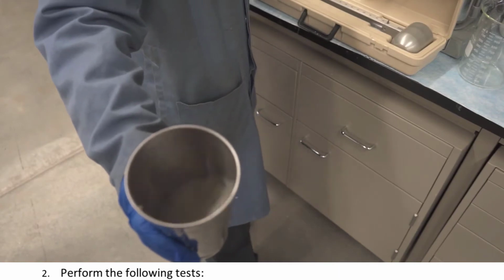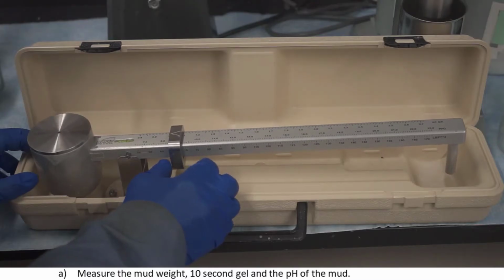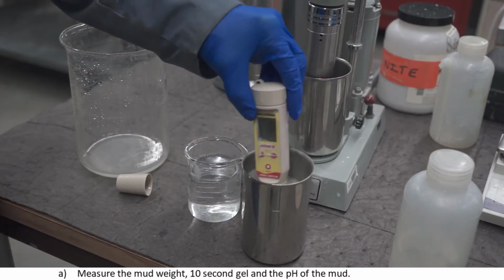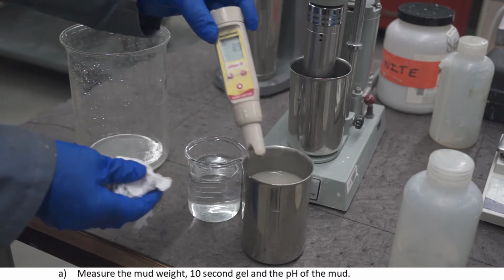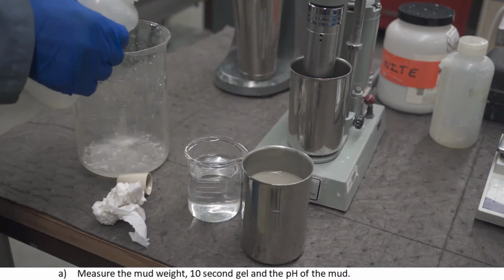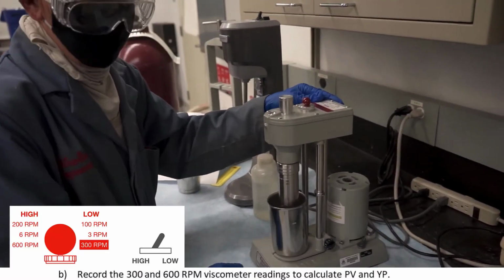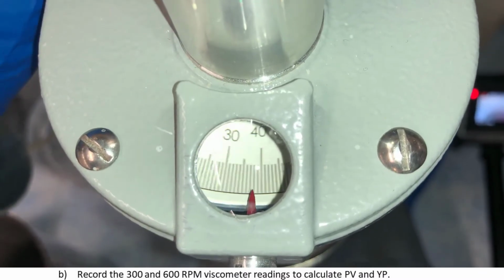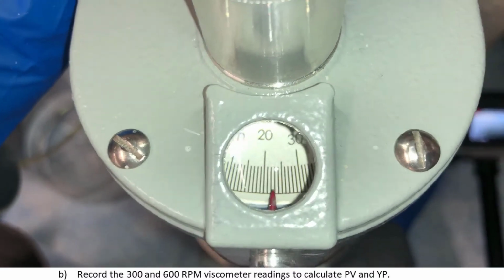You will then need to take a number of measurements of the base mud sample. Measure the mud weight, 10-second gel strength, and the pH of the mud. Also record the 300 and 600 RPM viscometer readings. You'll need these values to be able to calculate PV and YP.